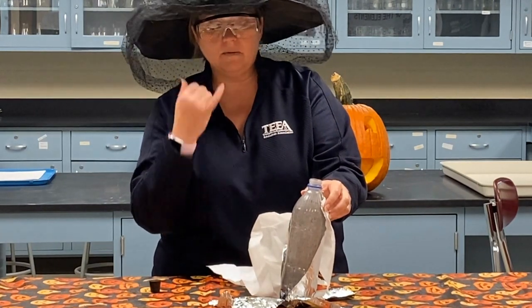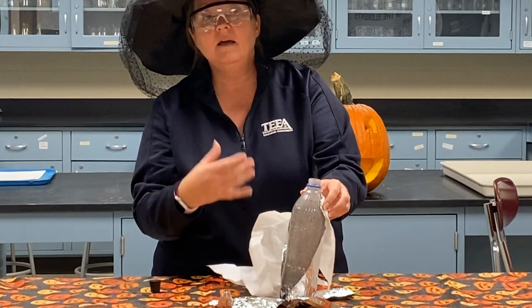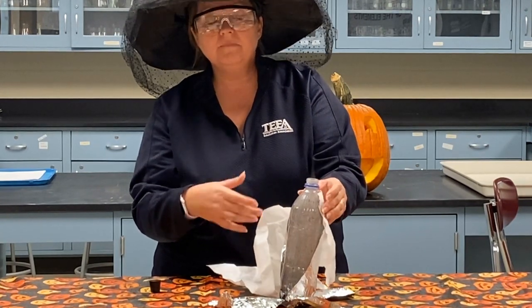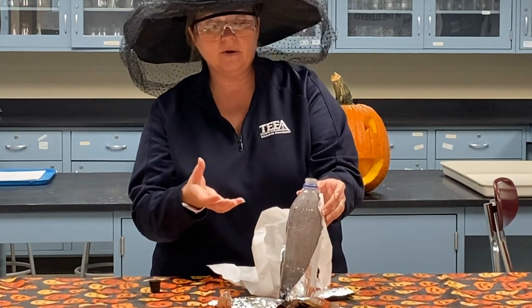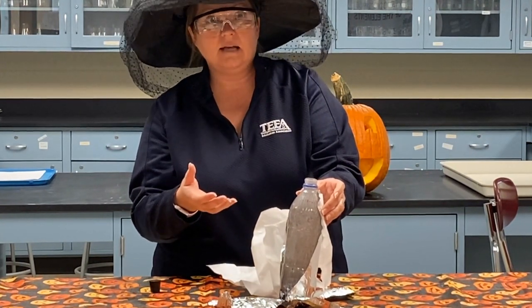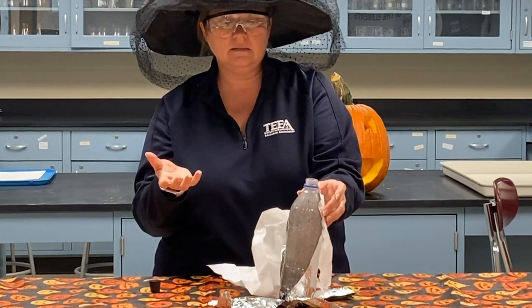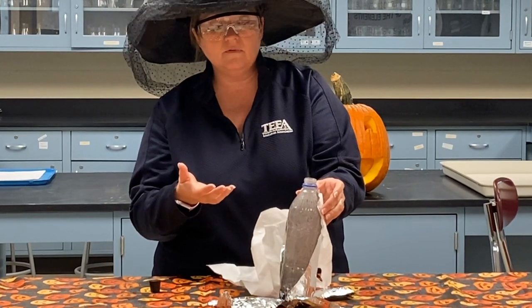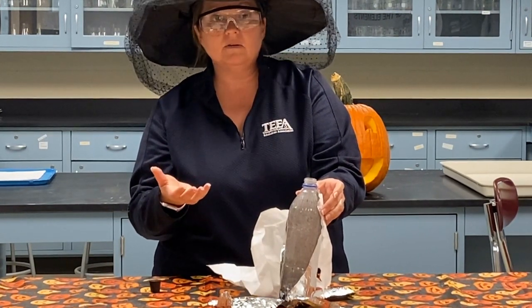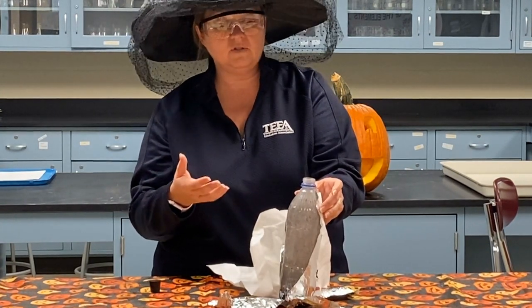and the reaction to take place, which gave off a tremendous amount of energy, hence the heat, vaporizing a lot of the water and creating what looked like smoke from the water vapor, but that was really the oxygen gas that was leaving. So oxygen gas is normally colorless. We look around the room, we can't see the oxygen gas, but because of so much heat, it created a lot of steam from the water that was there and mimics looking like smoke. If you were here, it doesn't smell like smoke, okay? It really is just water vapor.